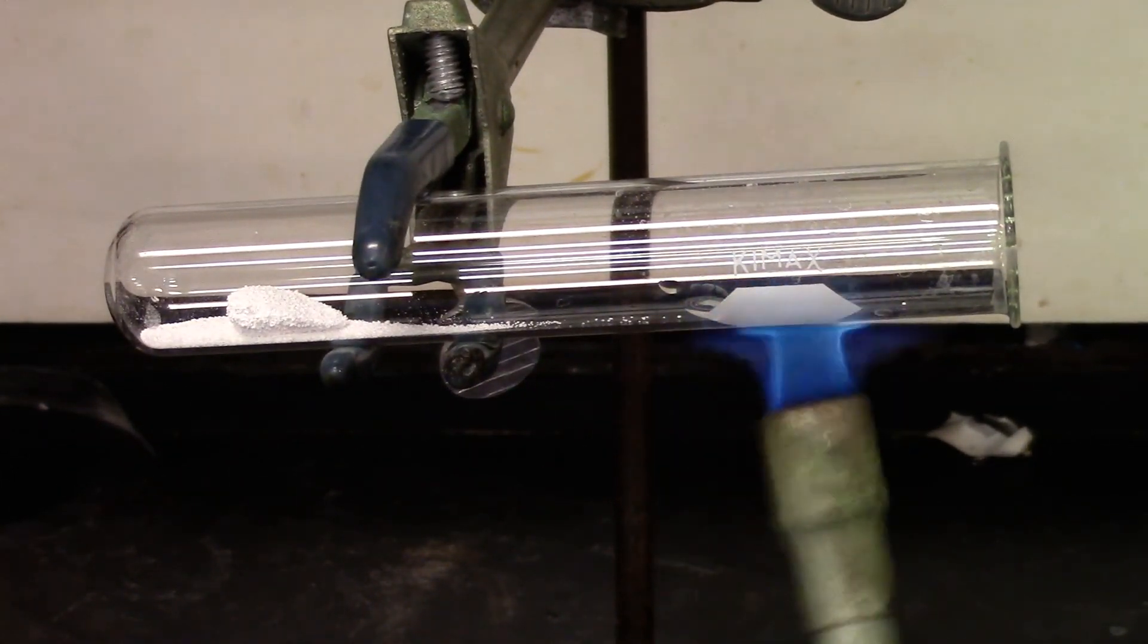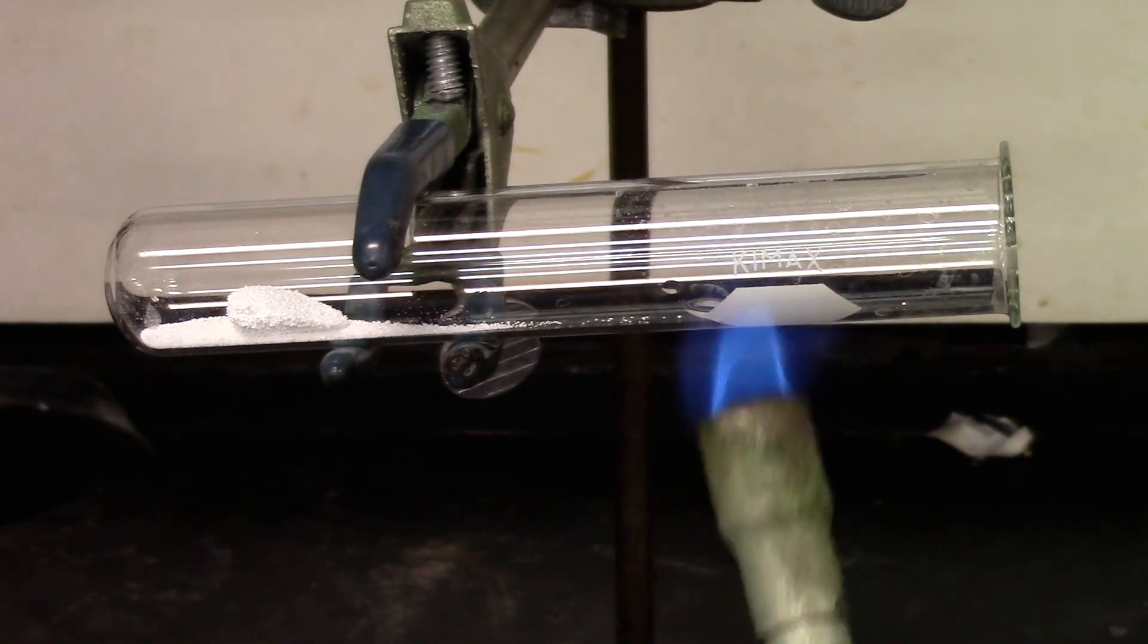So I'm going to heat it a little bit more to get the couple drops of moisture from the top of the test tube.